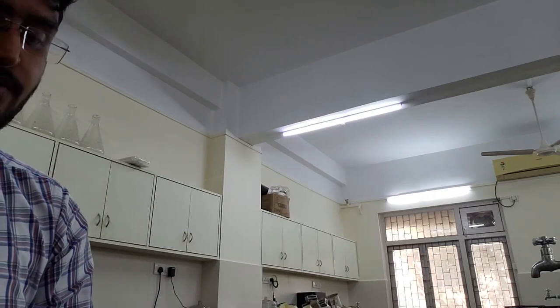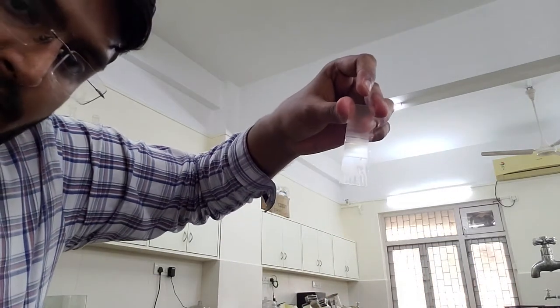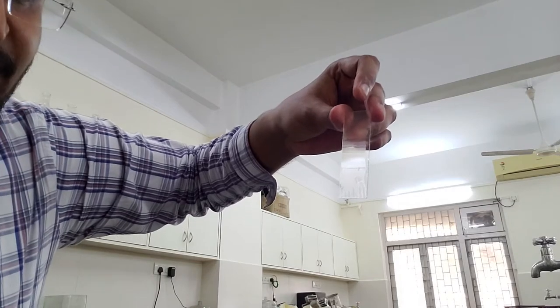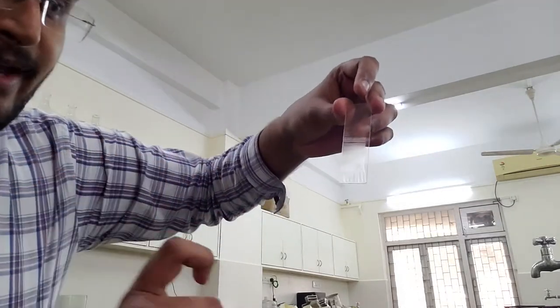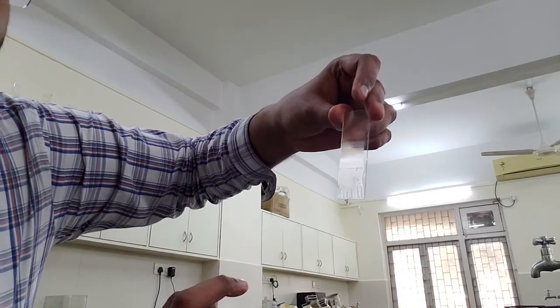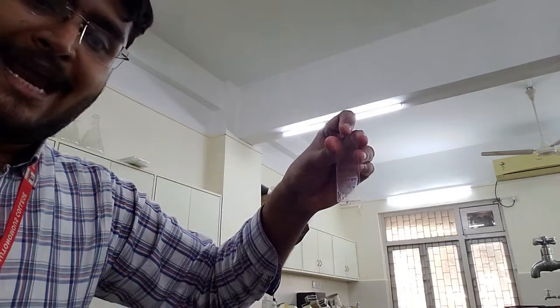Now you can see that this is the film that has been formed on my slide. Though there are gaps which shouldn't have come, because I was handling my bleeding finger there are some gaps, but that's okay. We have got a comparatively thinner film.